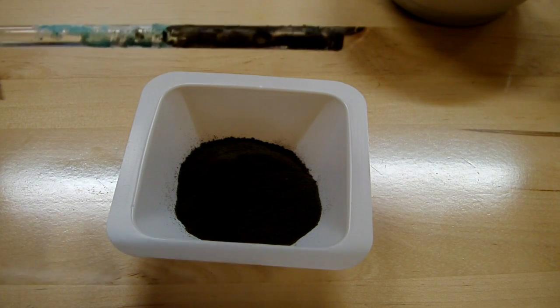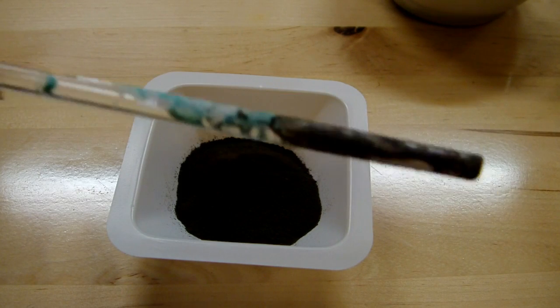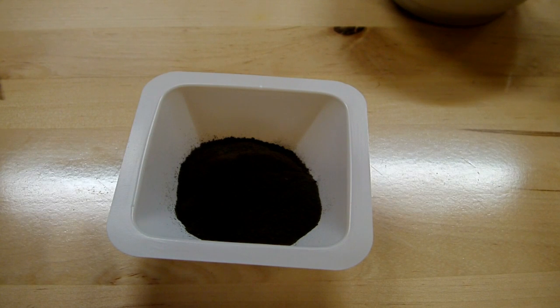And you can actually see this on the stir rod that I used. The top part of it is the blue color that the copper hydroxide is supposed to be, because that section dried off quicker, and then the rest is the black of the copper oxide that was still wet.